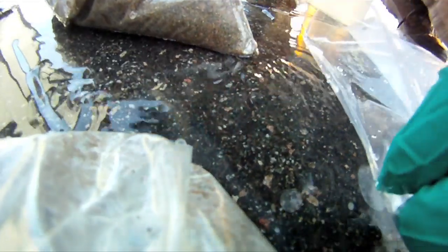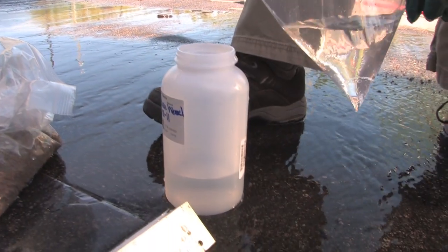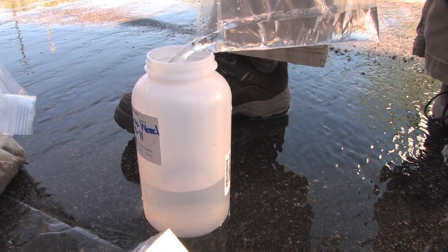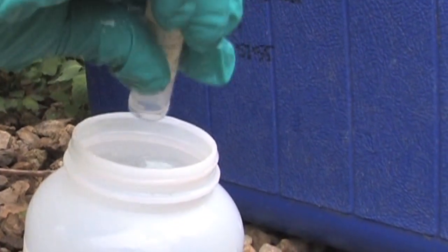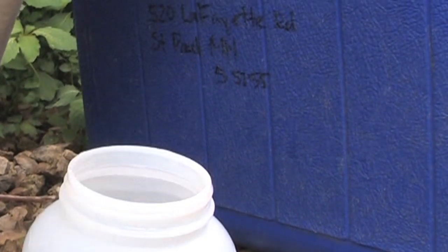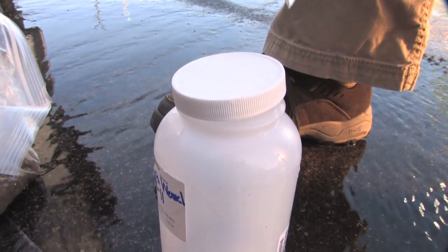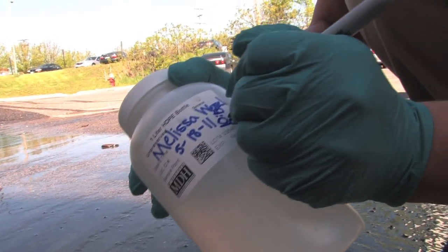You'll notice that I'm not placing my fingers or hands over the top or inside the bottle when collecting the sample — otherwise, I might contaminate the sample. Your lab should have instructed you how full the bottle should be; fill it to the level they instructed. If the sample bottles came with preservatives, add them now. Be careful not to spill, as preservatives are most often acids. Cap the sample bottle, then record the time the sample was collected.